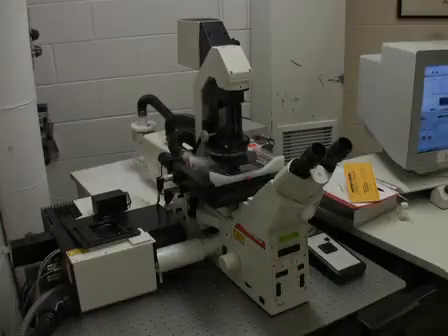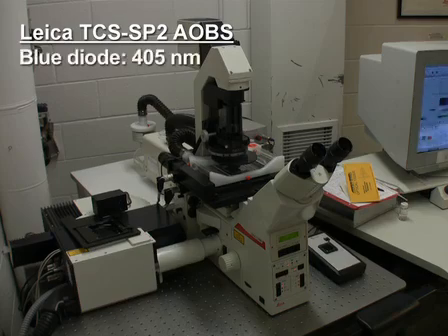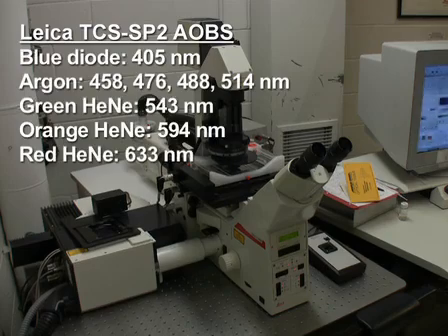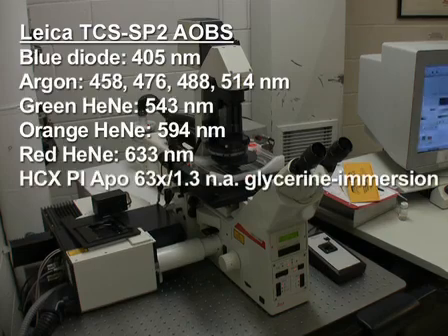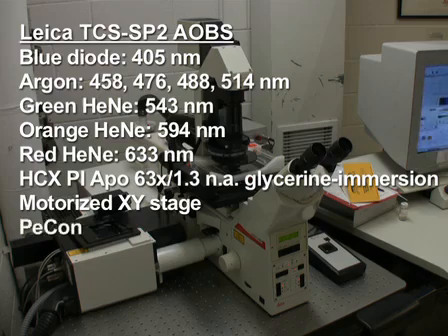To perform live cell imaging, we use a Leica TCS SP2 AOBS confocal laser scanning microscope equipped with blue diode, argon, and green, orange, and red helium neon lasers, an HCX PL APO 63X 1.3 NA glycerin immersion objective, a motorized XY stage, and a temperature, humidity, and carbon dioxide controlled stage incubator.